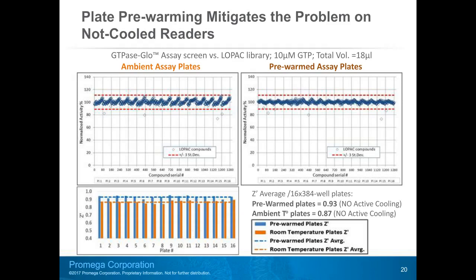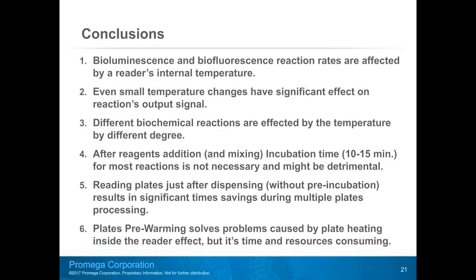The lower graph illustrates the benefits of pre-warming plates as evaluated by Z prime calculations for all plates with and without pre-warming. Pre-warming the assay plate raises the Z prime average by 0.06 units. So as you see, plate pre-warming can successfully mitigate results scattering caused by reaction temperature increase inside the reader. Unfortunately, plate pre-warming is also a time and resources consuming step.